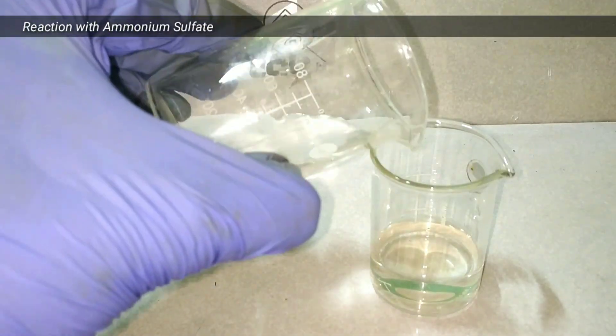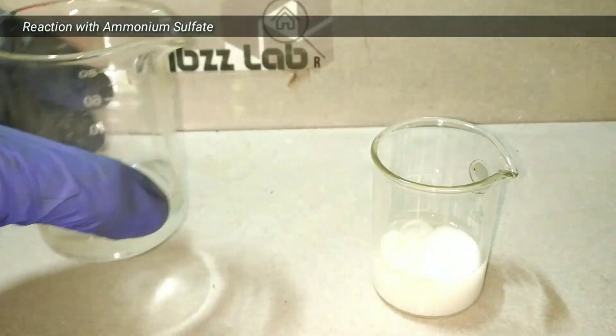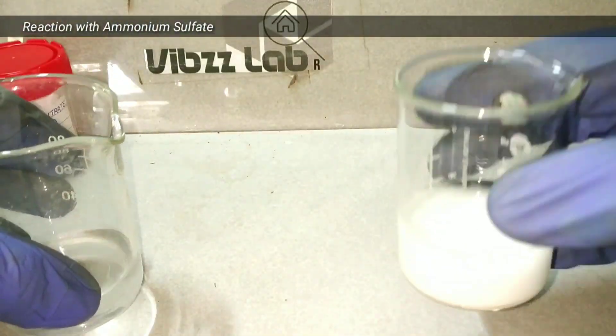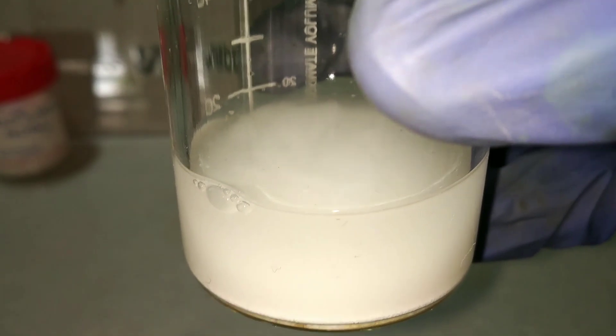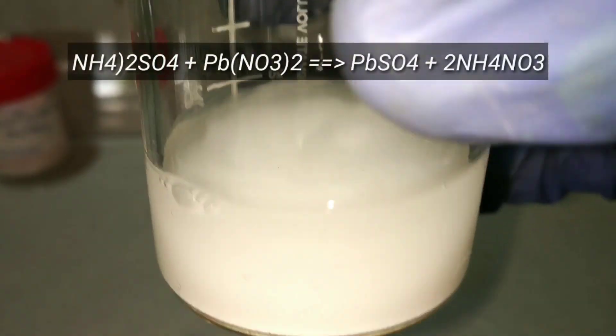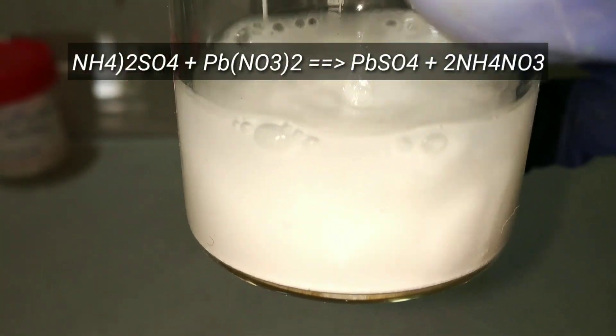Lead nitrate also reacts with ammonium sulfate in a displacement reaction, forming lead sulfate, which is a white precipitate.